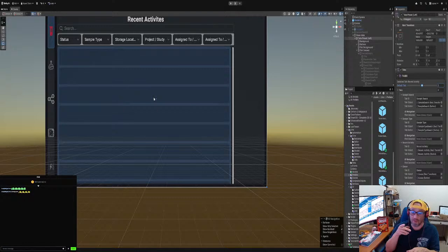We have history for the audit, and then we have a chain of custody, which basically means if I handle one part of the sample, who is the next owner? So the first owner is the creator. Then the next owner is going to be the tech lab guys, or whatever workflow they got, or it could be an approver, or a doctor, or somebody else. So that's called a chain of custody. Who is the current owner and past owners of the sample, the test, a report, or an inventory. It could be a patient.